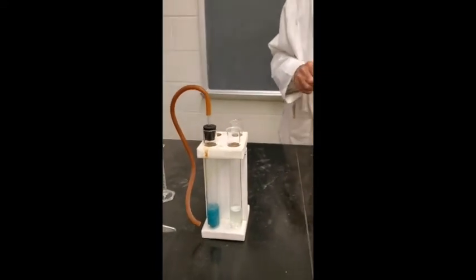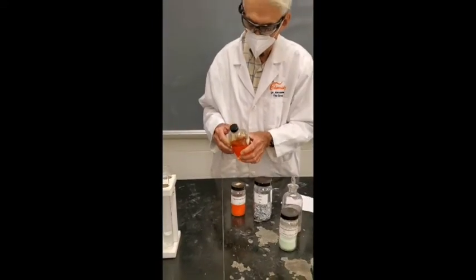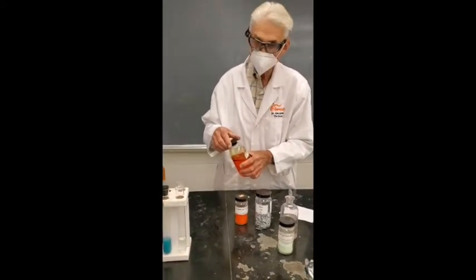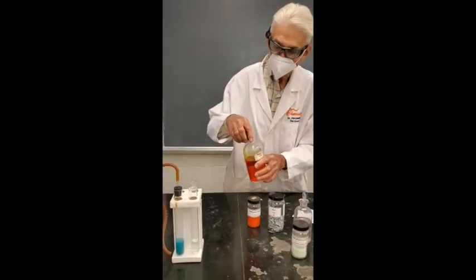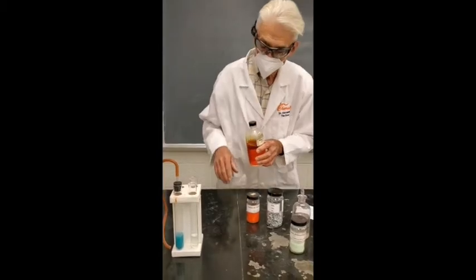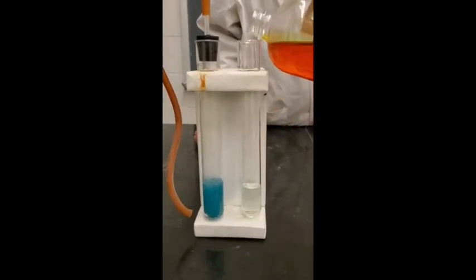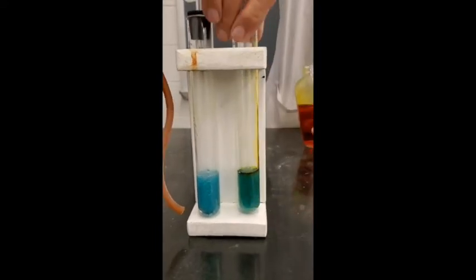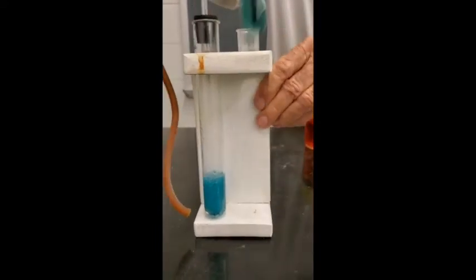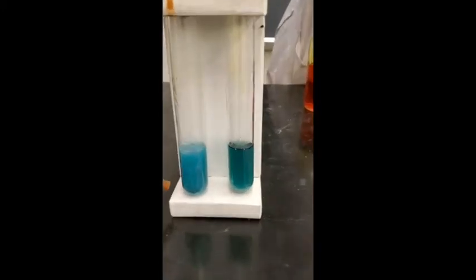And when it oxidizes it from iron 2 to iron 3, the dichromate, with the +6 oxidation state for the chromium, is actually reduced to chromium 3. And we now know the chromium 3 is green, right? So let's see if there's any evidence of that happening. Is there any evidence that it turned green? It sure did. So we reduced it from chromium 6 to chromium 3, and that's chromium 3.